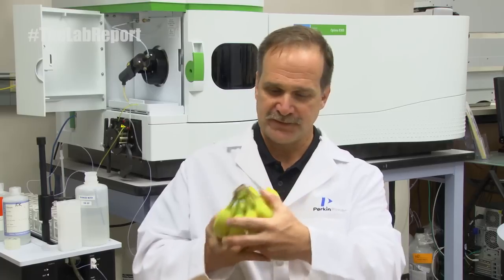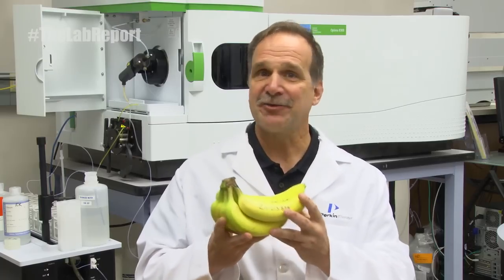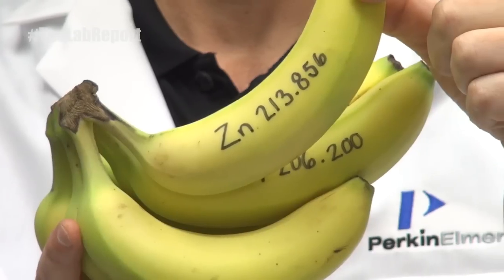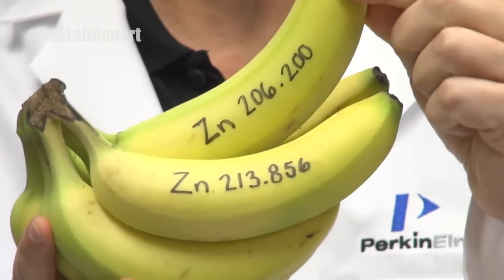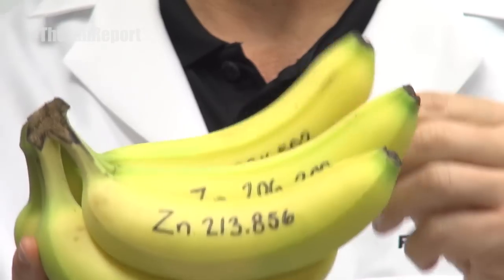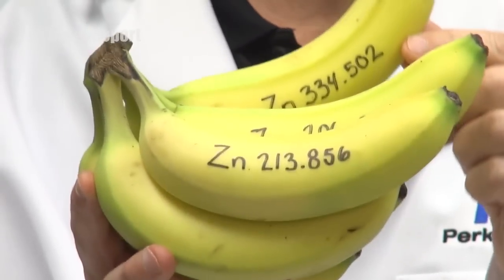Same kind of thing with UDA. With UDA, if you went and you wanted to look for zinc and you picked the wrong wavelength — you're gathering all the information at once, it's still there. You still have zinc: 213.856, 206.200, 334 — you have the whole bunch of zinc wavelengths that are there for you. All you have to do is put them into your method and reprocess them.